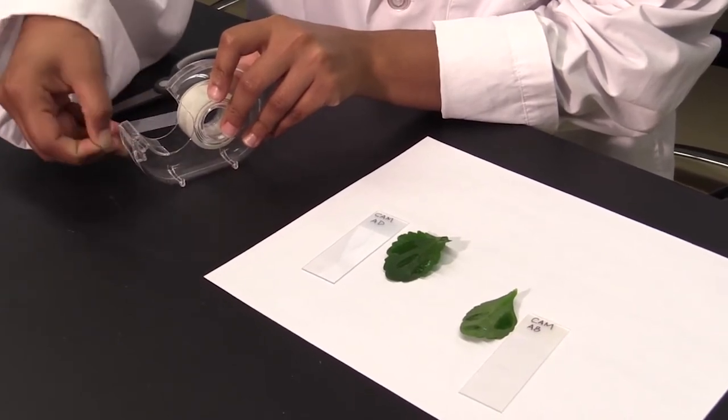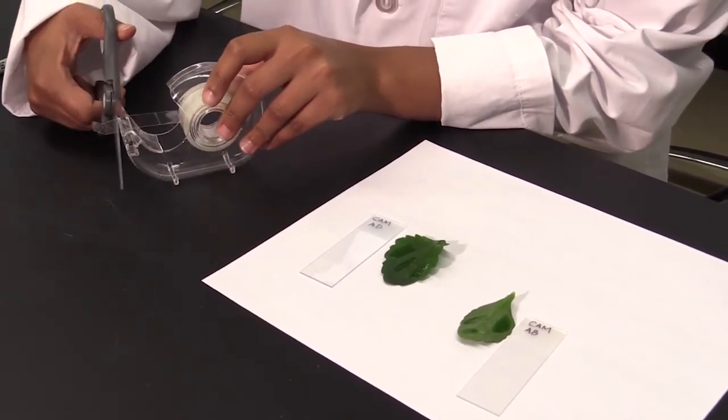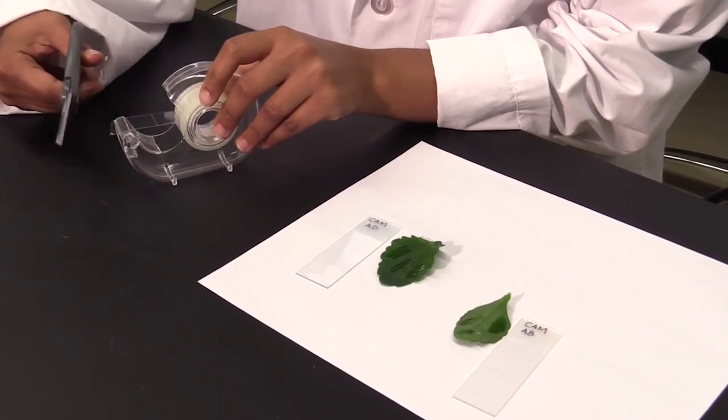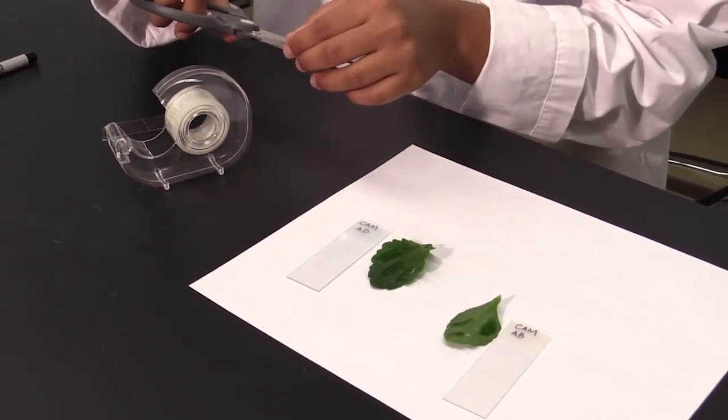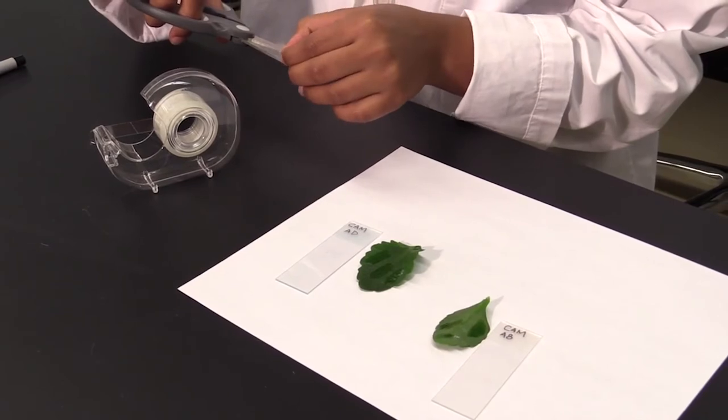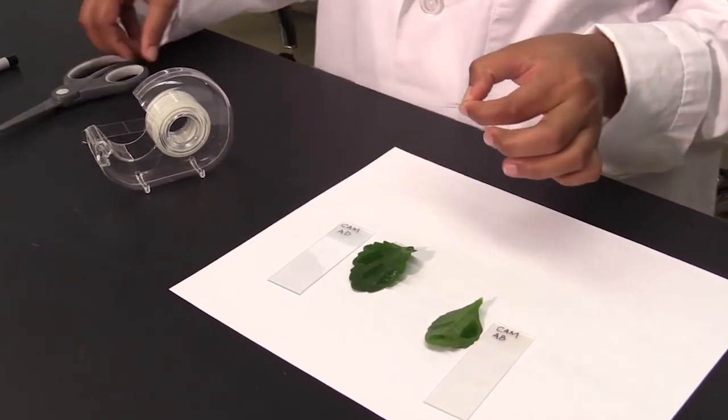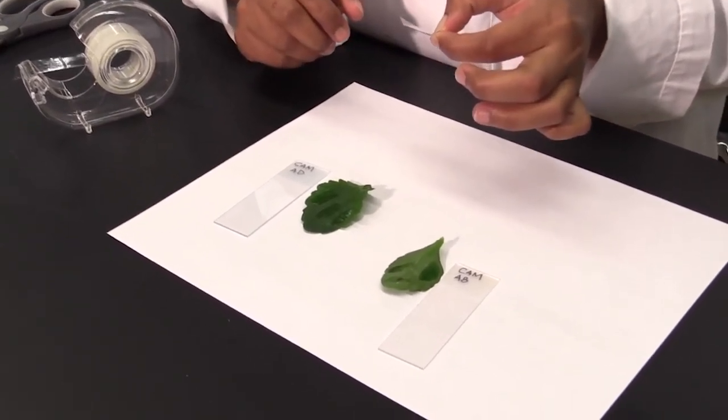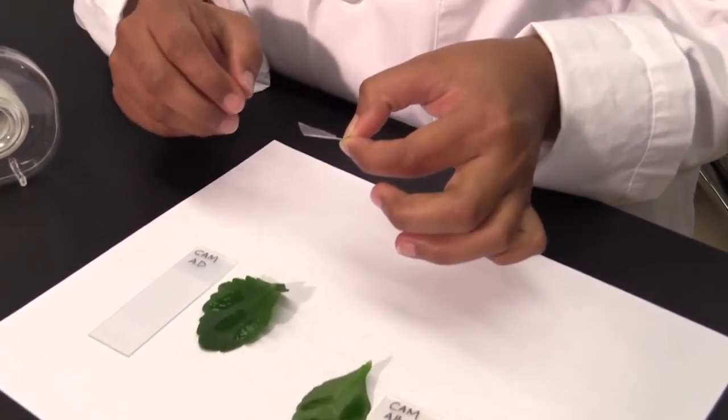When cutting the piece of tape, please make sure that you use the scissors and not rip off the tape. It is also crucial that you do not get fingerprints anywhere on the tape. Make sure you hold the tape by the edge.